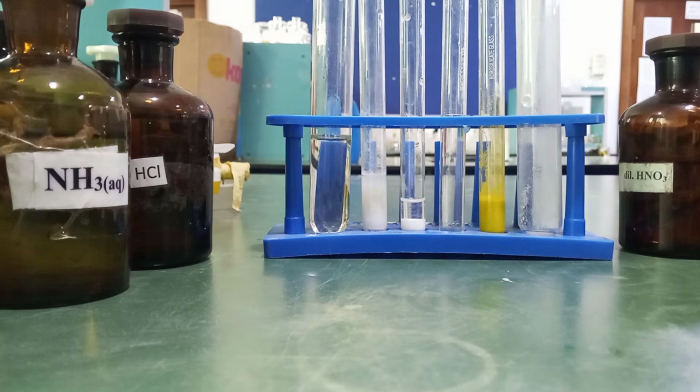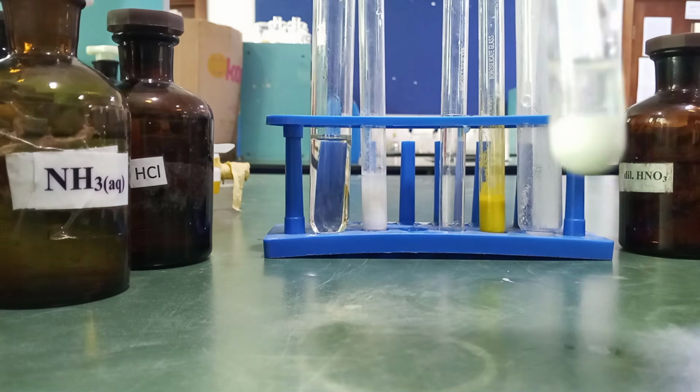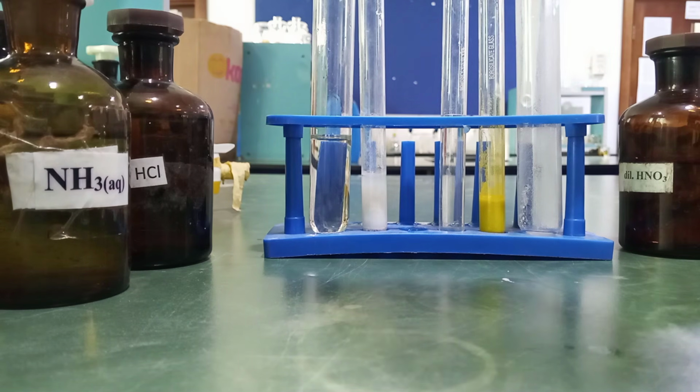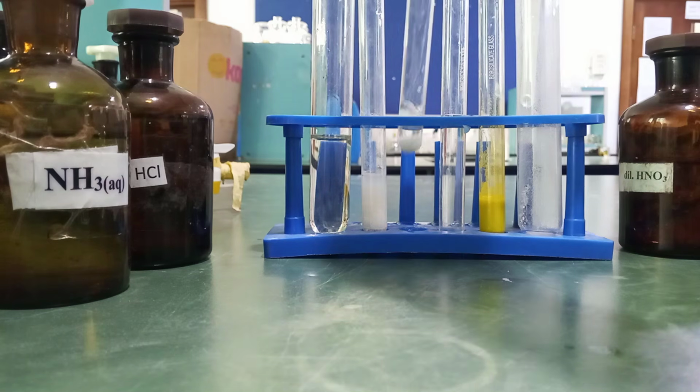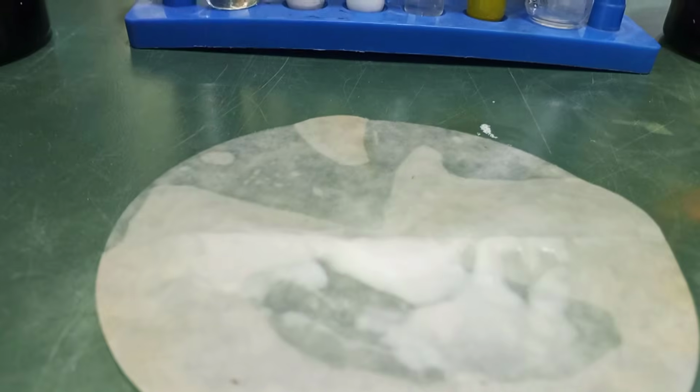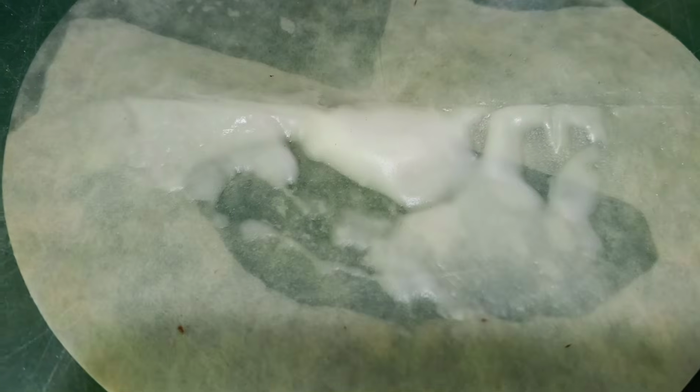So in your own case, you can put this in hot water and leave it for some time. You see that after some time it will dissolve, and when you remove it from the hot water and allow it to stand, the white precipitate will do what? Reappear. All right. So after this, let's now move to our residue. So this is our residue. Can you see it? Can you see the white deposit? Yeah, on the filter paper.